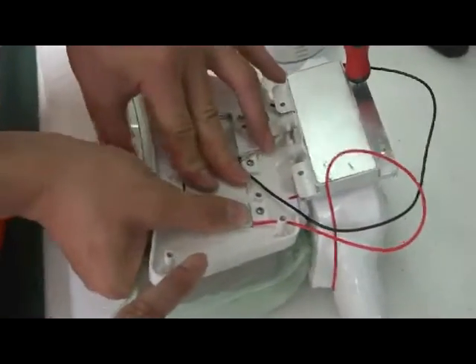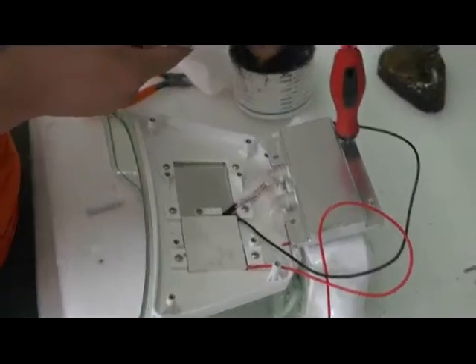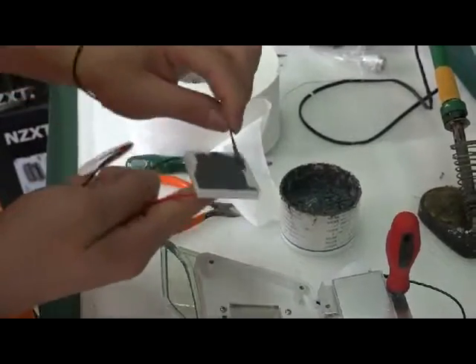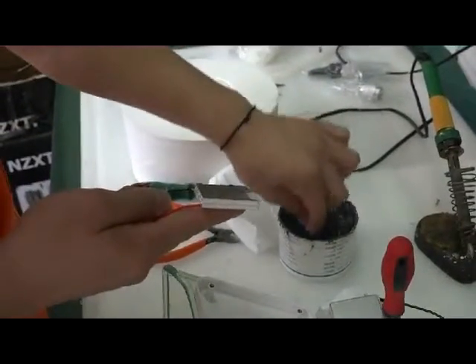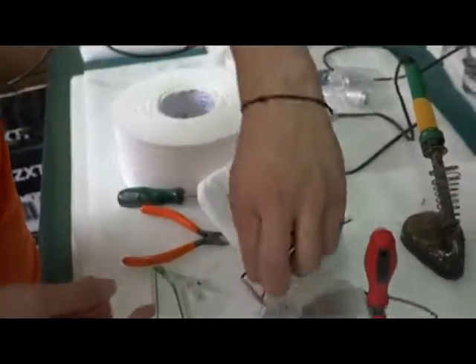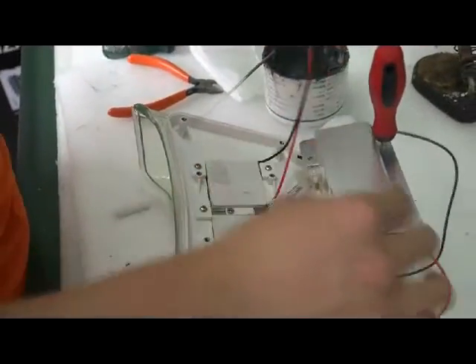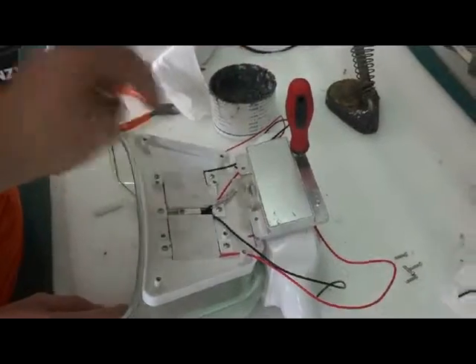When putting in this area, just to remind, red wire here and black in the middle. Then we smear some silicone on another surface. Smear evenly and cover all the surface of it. Push it to make sure they're connected well. Okay. Push it. It's okay. Now for this one, red should be in the middle and the black on the side.